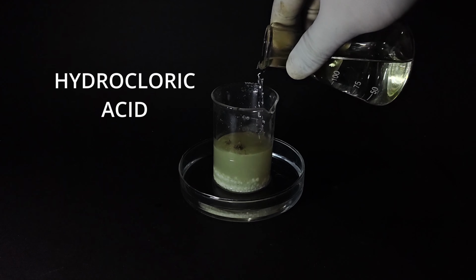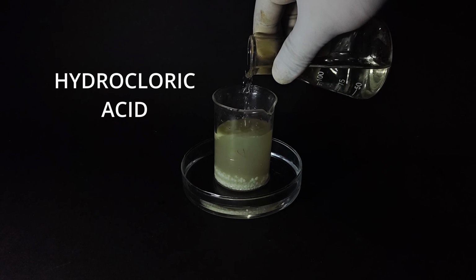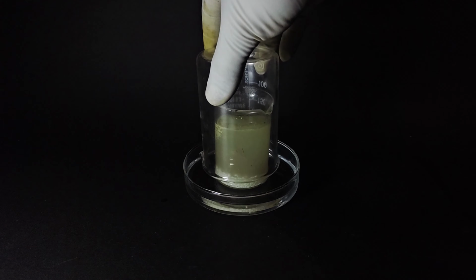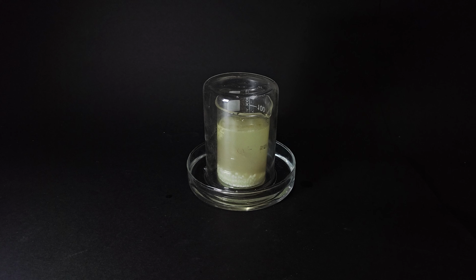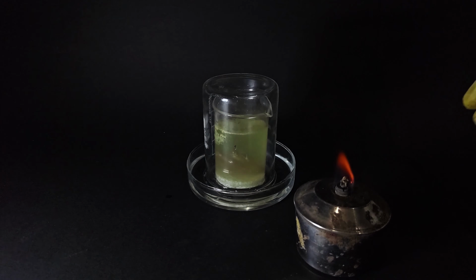And to the beaker, I will add some hydrochloric acid. This will initiate the reaction. After that, I will put an inverted beaker on it. The reaction should have started immediately, but it doesn't. I start doubting myself and thought to heat it up.